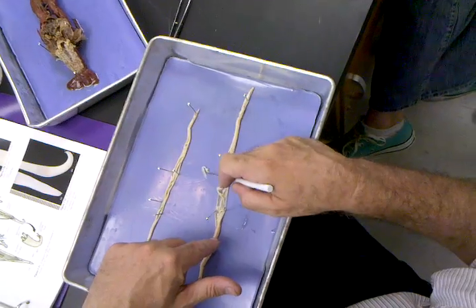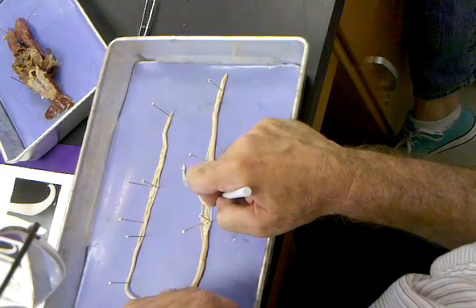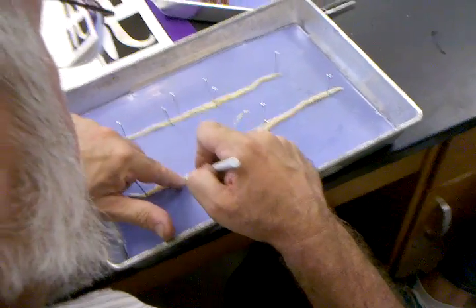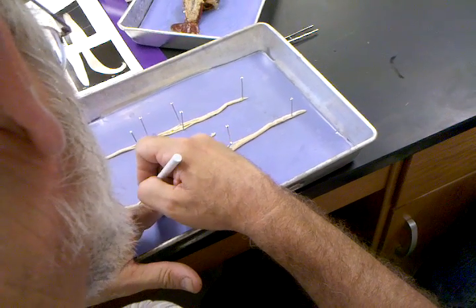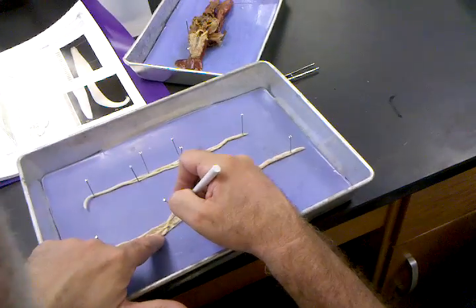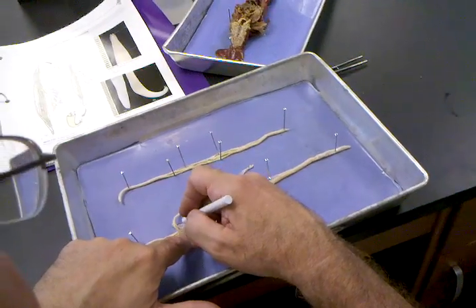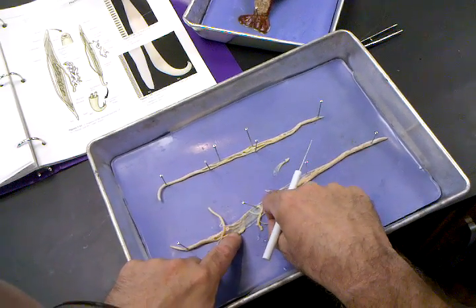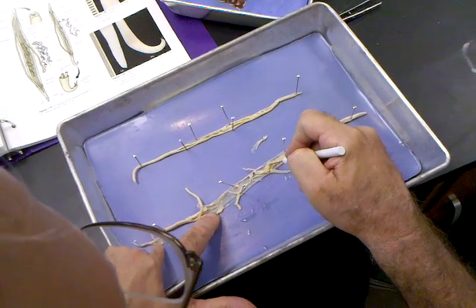Here we go. There's a nice section of intestine. Does everybody see that? Flattened structure, right? Intestine right there. Here's your bifurcated uterus right here. One uterus, another uterus. Do you see that? The largest tube — here's a uterus right there. Notice the intestine right there, flattened, right? I'm pulling the intestine out. Do you see that? That's the intestine right there.